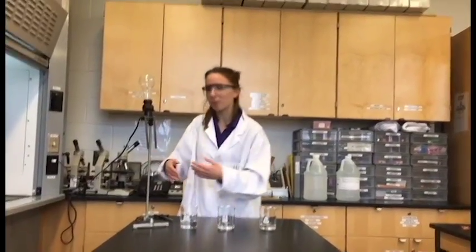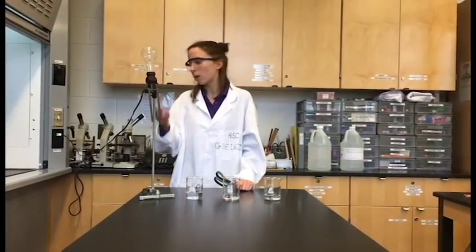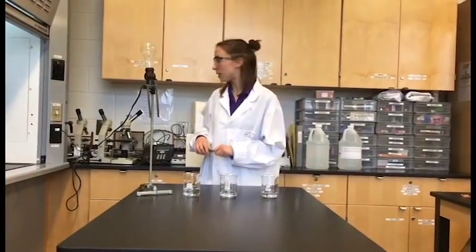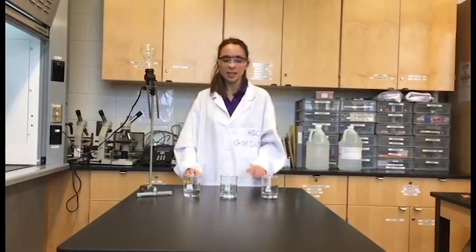Now we're going to see if these substances can conduct electricity. And we can test this by using this contraption. So what we have here is a light bulb and two metal rods. Now the light bulb, although it's attached to the wall, it's not turned on because the circuit here is incomplete. But if we take a conductor and we connect the circuit, then the light bulb will glow. So now let's test if these substances are able to complete the circuit.